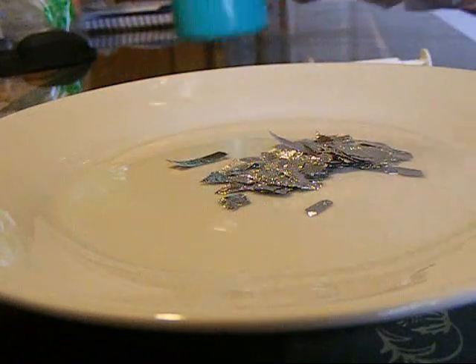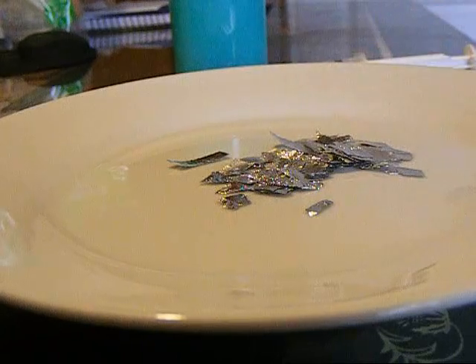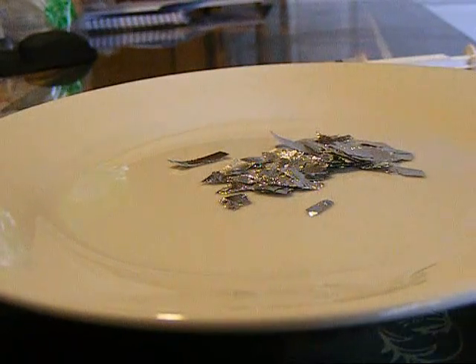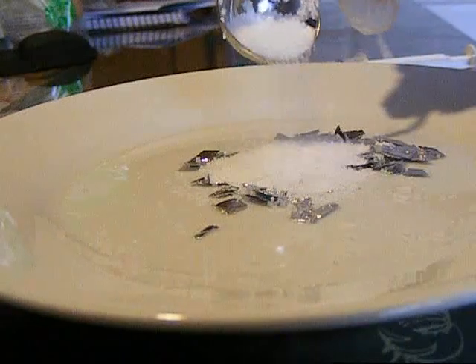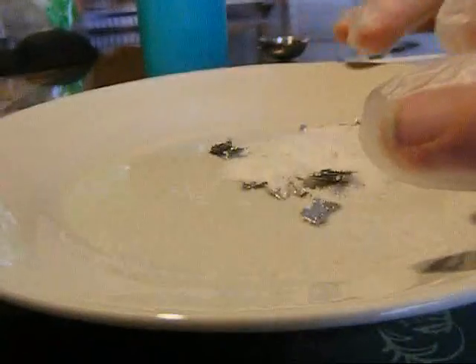This is Sodium Hydroxide reacting with water, which is 5 mL, on Aluminium foil. I'm going to place a tablespoon amount of Sodium Hydroxide, which is only about 50% pure, over these Aluminium foil. I'm just going to push these in, making sure I'm wearing gloves.